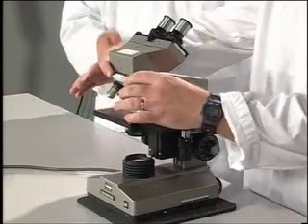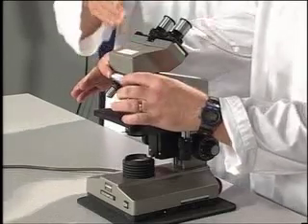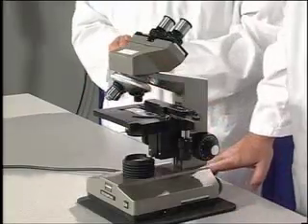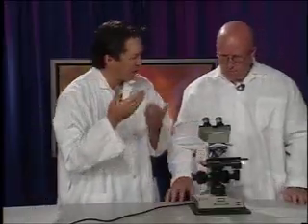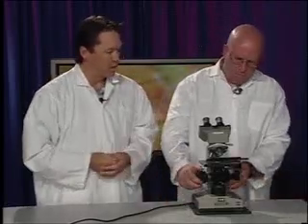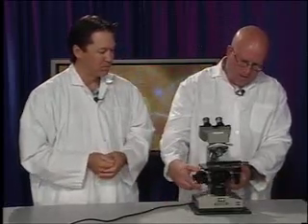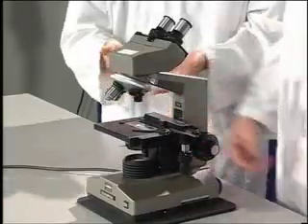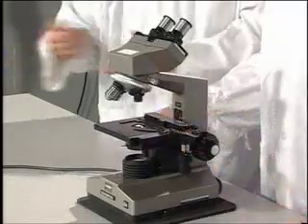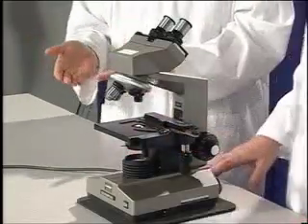Well, there I'm on blank. Would blank work too? Yeah, it's nice to put it on low so that the next person that comes in doesn't have to worry about that. Gotcha. I'll put it on low. And now what we can do is take our coarse focusing mechanism and lower it right to the bottom. Okay, good. And then remove the slide, and in this case, you could dispose of it in the appropriate place, or if you were using a prepared slide, you would put it back into the box that you got it from. Good.